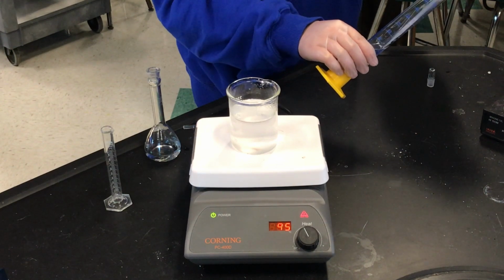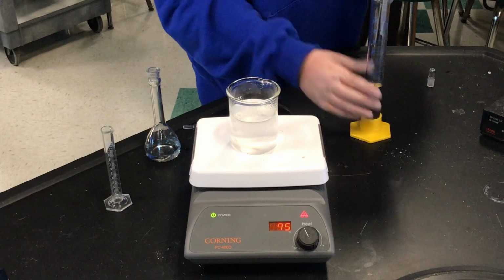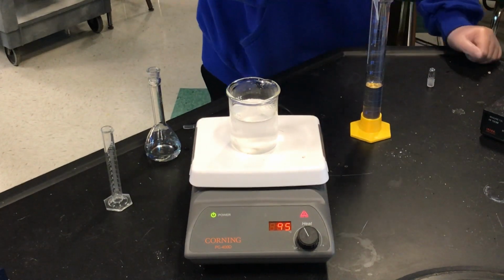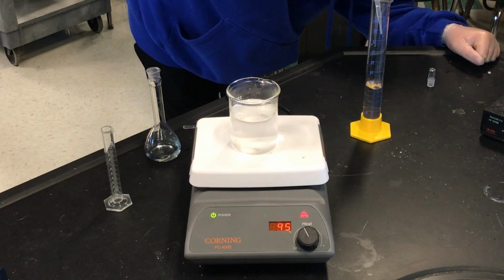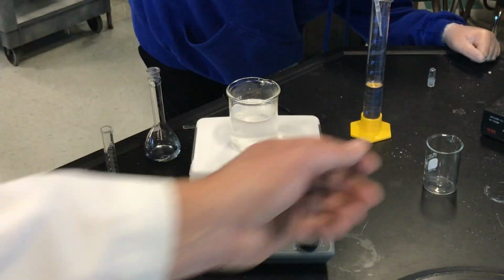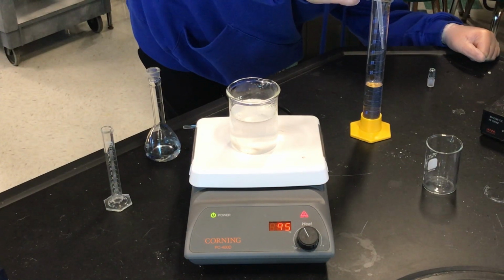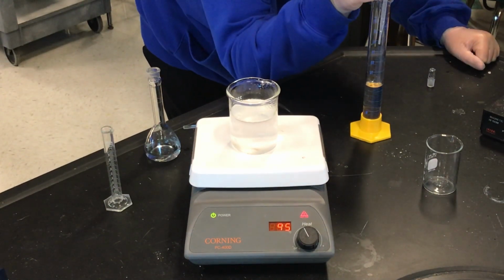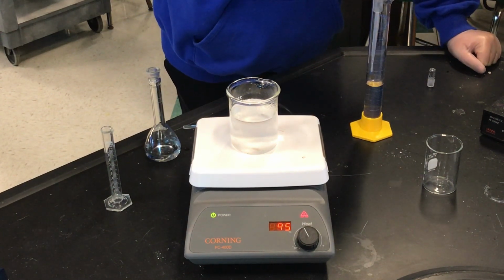Now, what are you taking out? Not water, right? Just the pure base? Yeah. Okay. Put that in a waste beaker. Don't put that back in your reagent bottle. Anything you're taking out, put that in a waste beaker. Okay, good man. So he's measuring exactly 44.5 milliliters. Another tedious measurement to make sure you have exactly the moles.